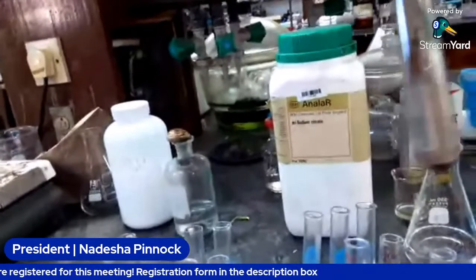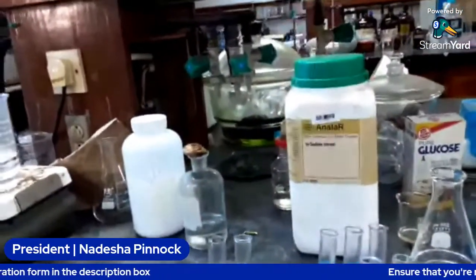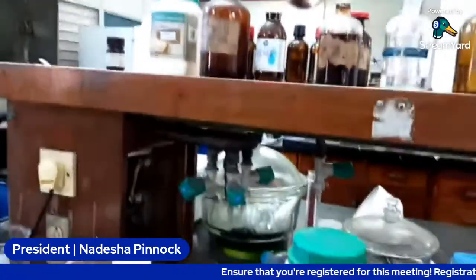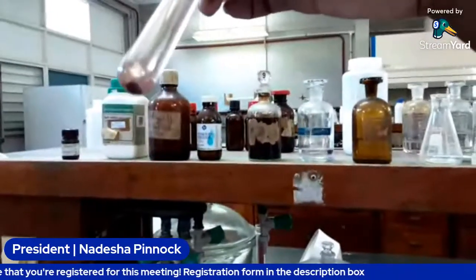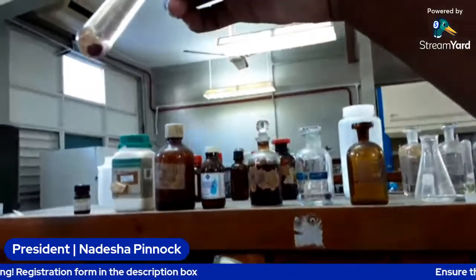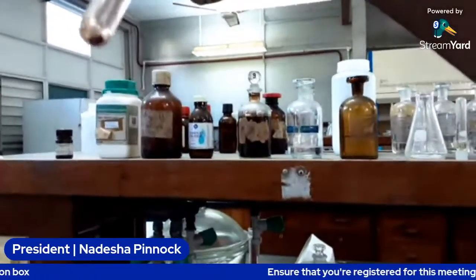And this one was our sucrose. The solution appears a bit clear, but there is precipitate at the bottom. So there you can see the precipitate.